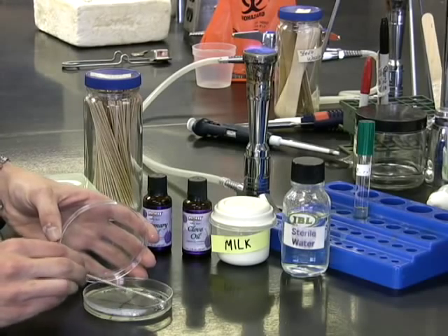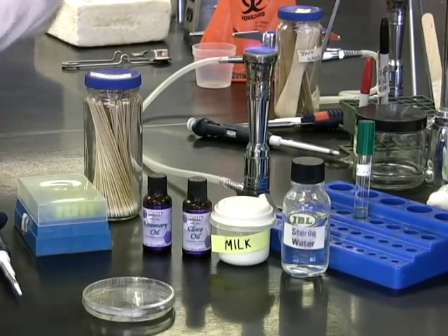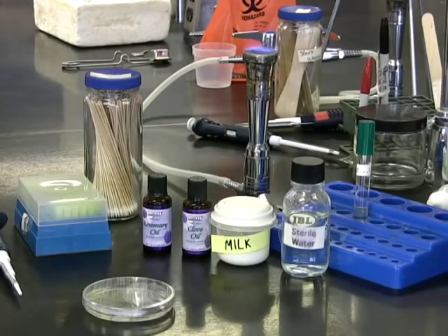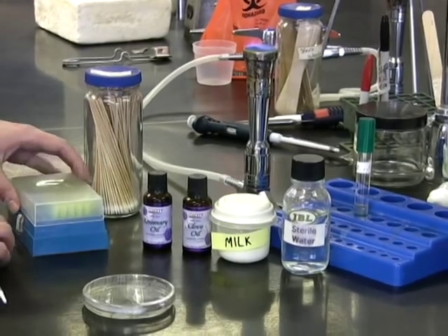You will notice that the bottom of the plate is separated into four quadrants — one for each of the three food products you are testing and one as a control.